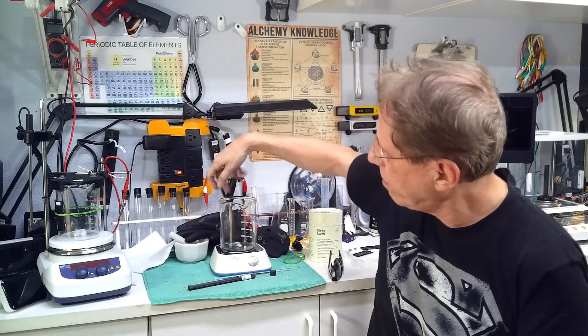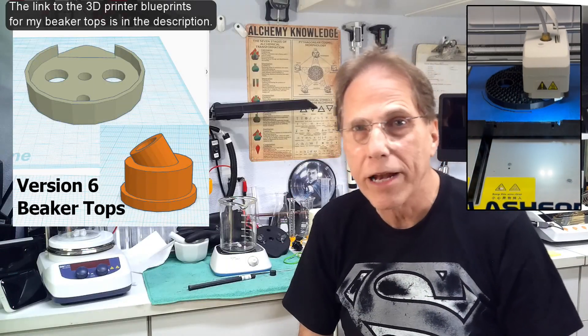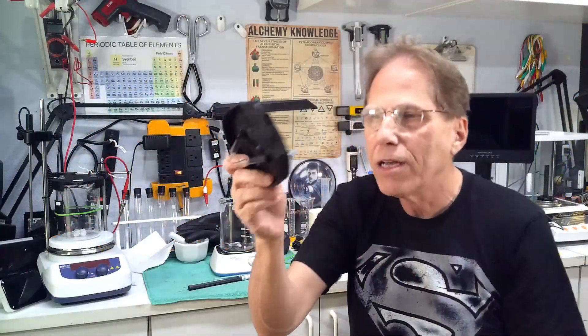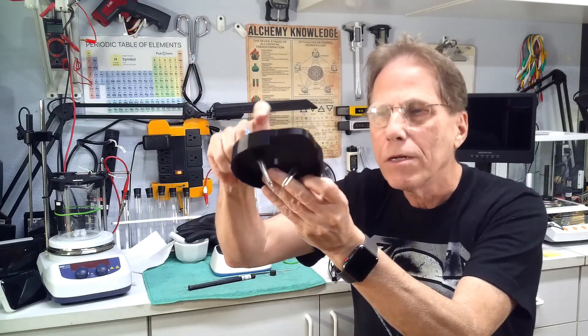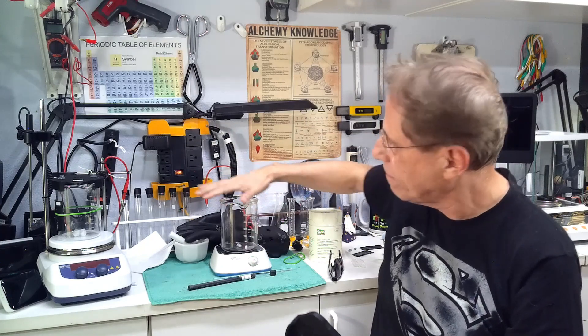Before I had the tops, it was really difficult to create a plasma arc with just glass tubes taped in place. For those starting out, you can tape glass tubes to the sides of the beaker and finagle it that way. If you have access to a 3D printer, the 6.1 top blueprint is available — you can print all the parts needed to create this top, which fits on a 500 or 600 milliliter beaker, making it much easier to create your plasma arc.